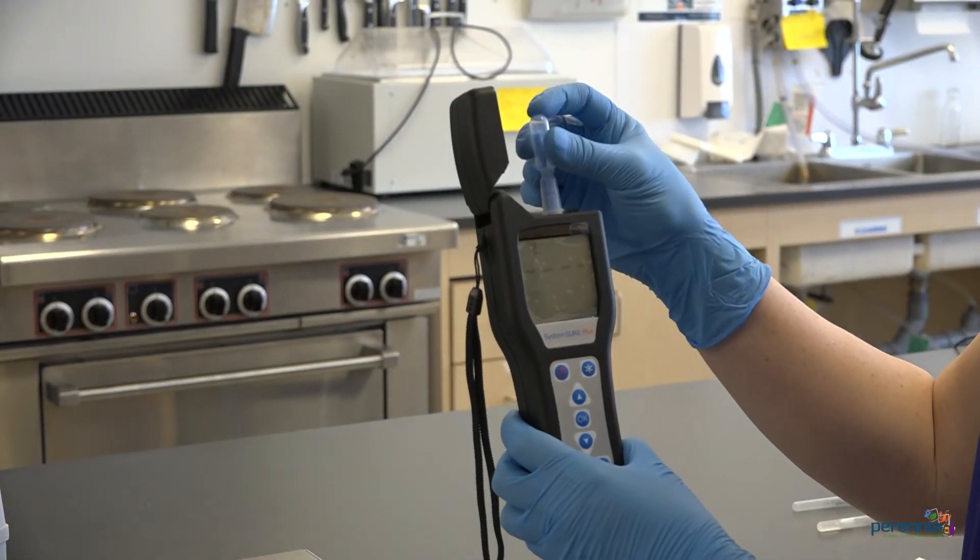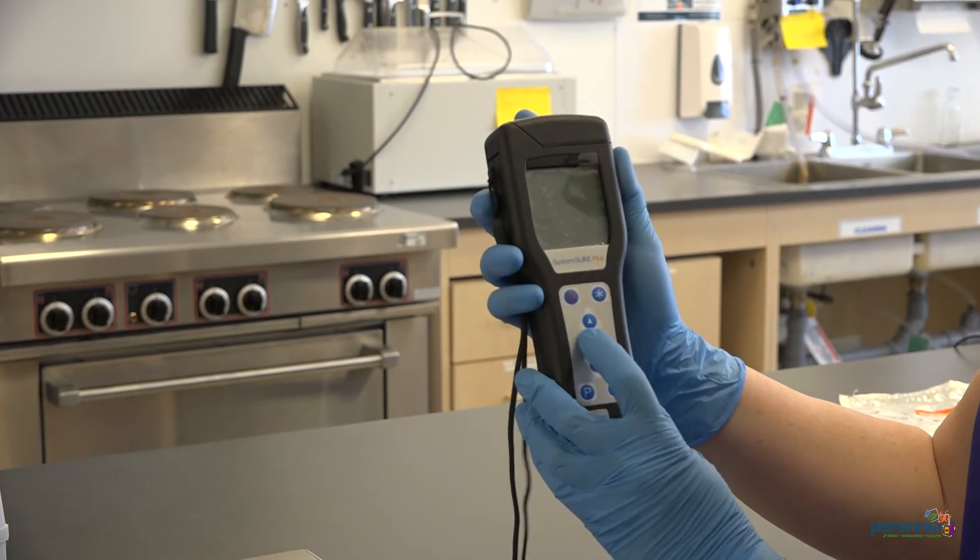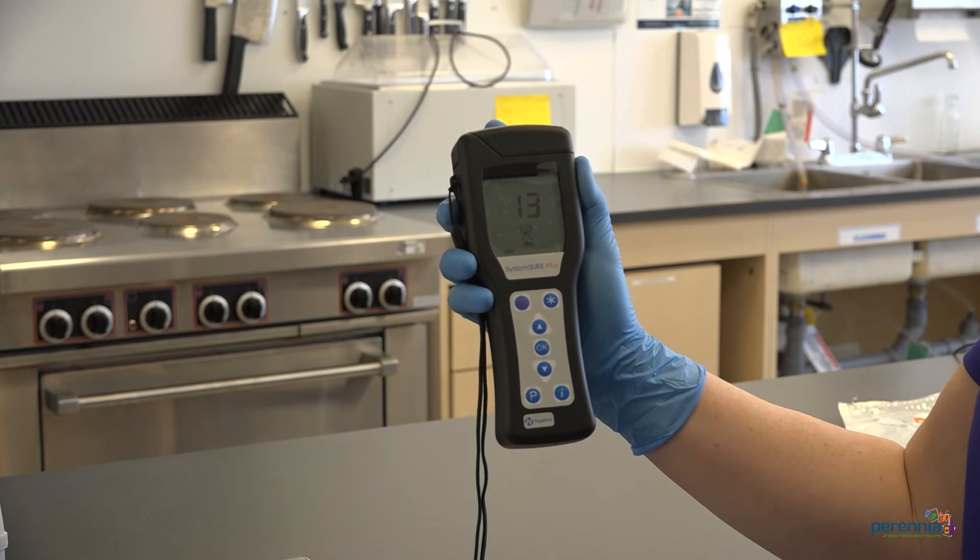Step number nine, insert swab into device and close lid. Hold device upright and press OK. Results are displayed in 15 seconds.